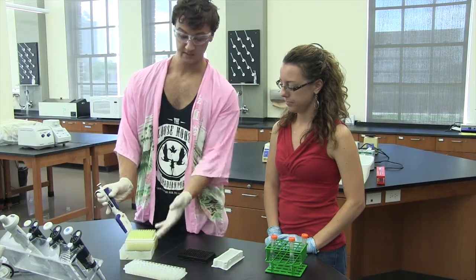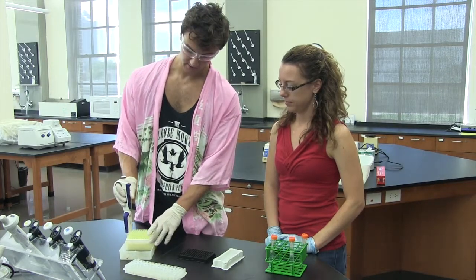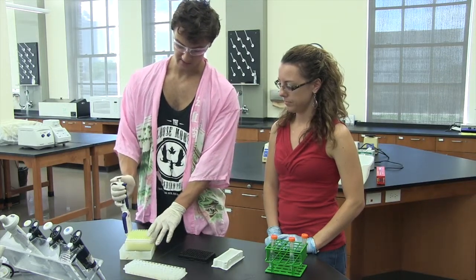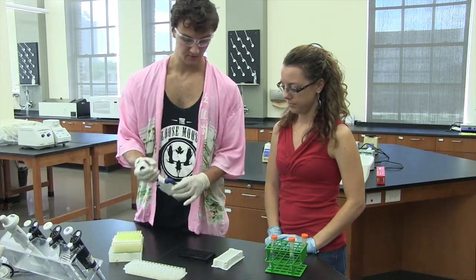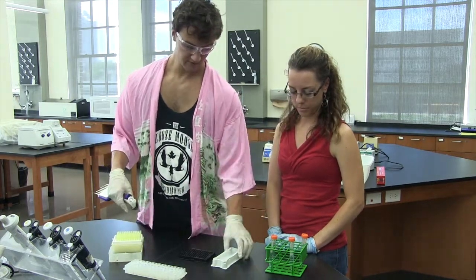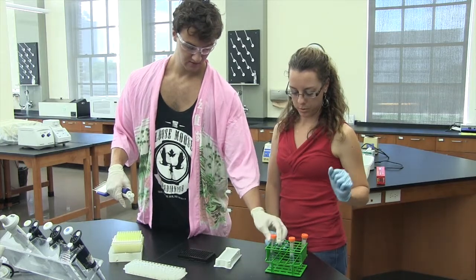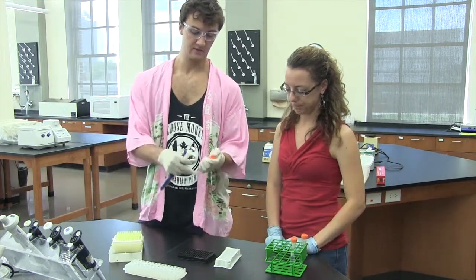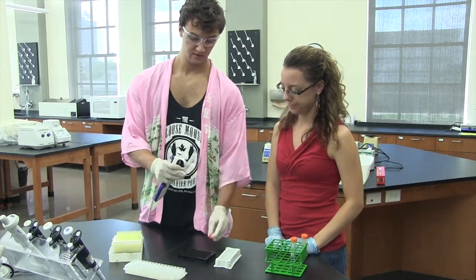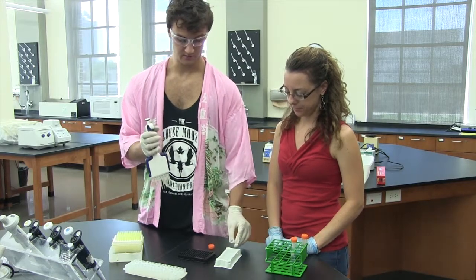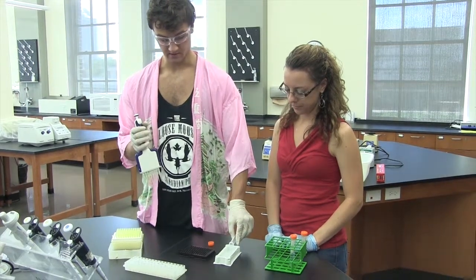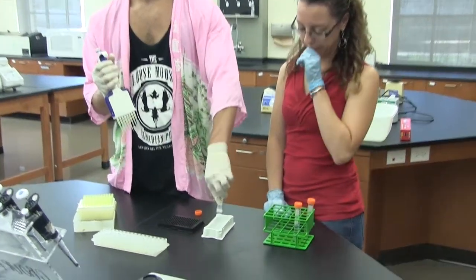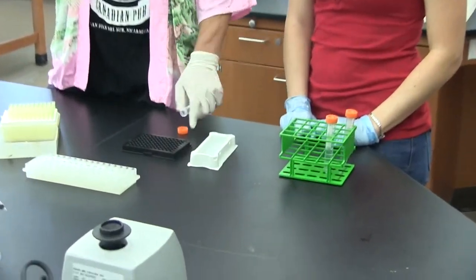Since I'm going to be having ten different samples, I'm going to just max this guy out and go with eight. So then you have these nice little wells here, so I'm going to be putting my buffer in first. You can just pour it into these guys right here, which have a nice little valley, so you can get all of that liquid out.